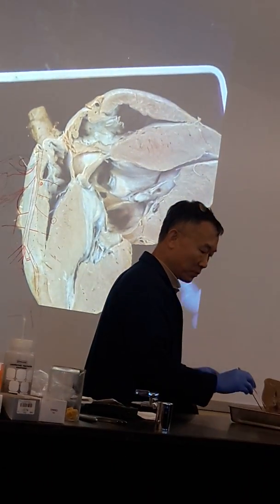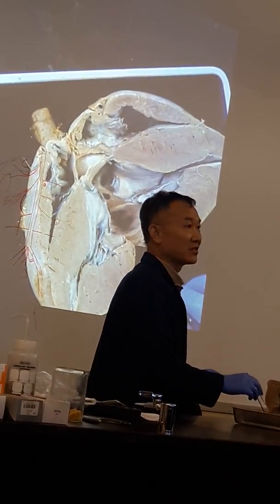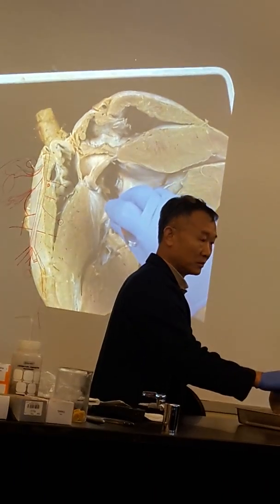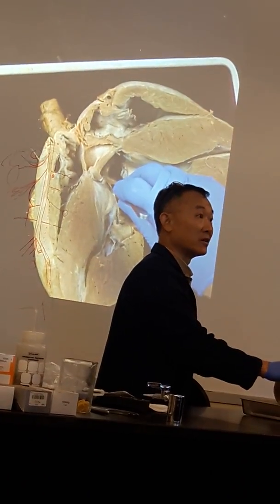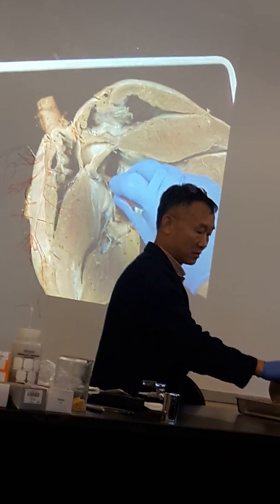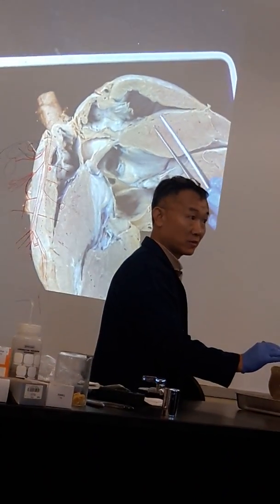If I put a pin in here, you can say coronary vessels. If I put a pin inside over here, behind the aortic valve, that's coronary ostium. You can call it ostium or coronary opening. So that's most of the internal structures.